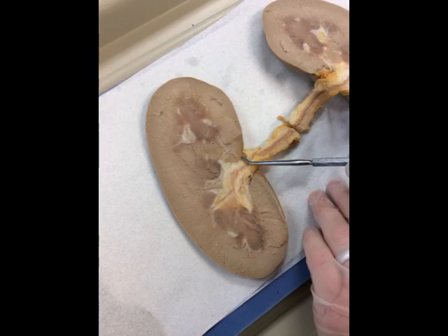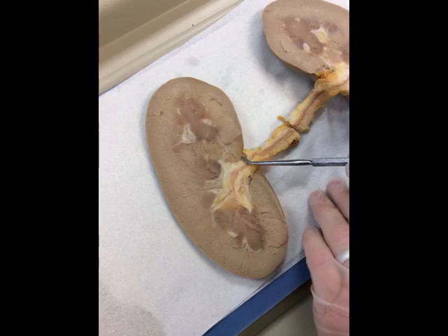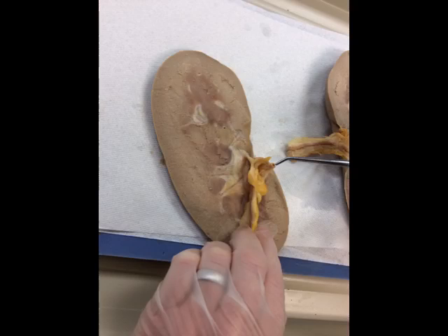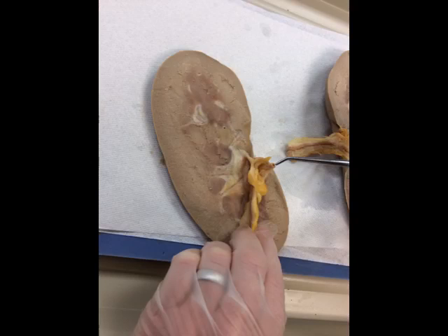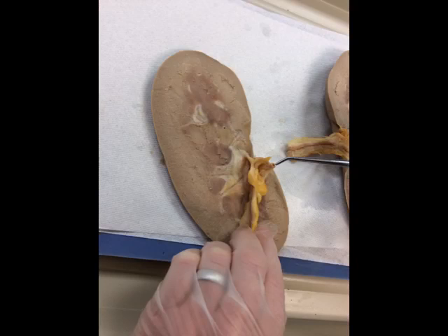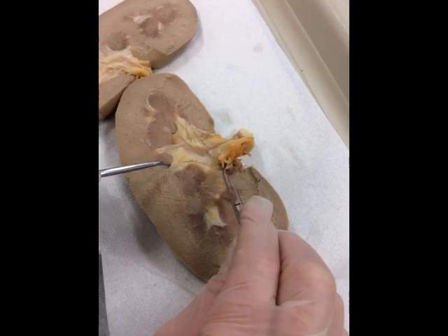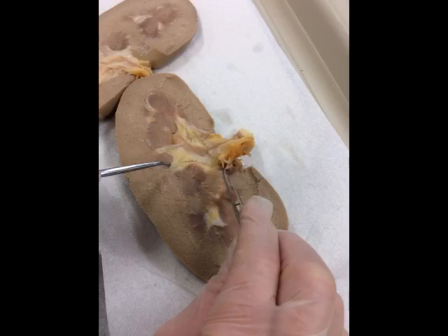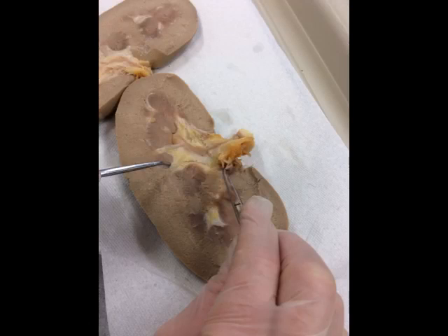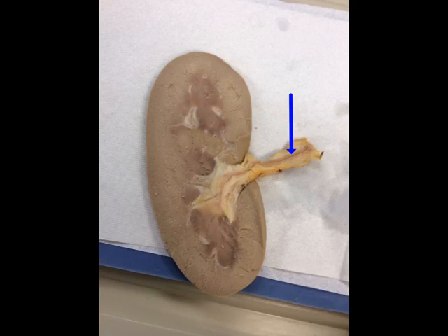From a mid-sagittal view, this is the hilum, the renal artery, the renal vein, and the ureter.